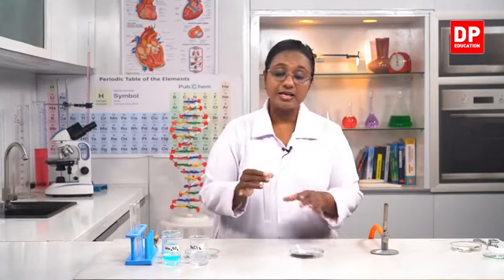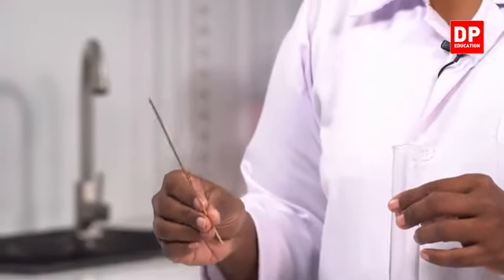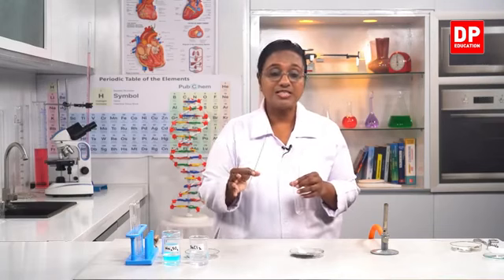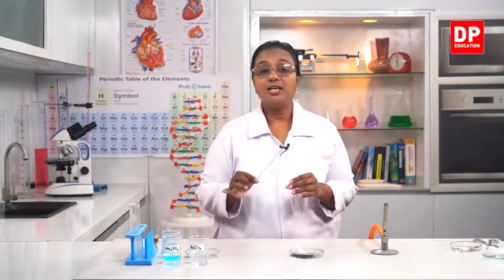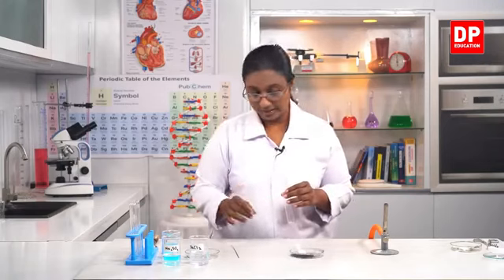Then what do we do? We need to take a boiling tube. Into that, I need to take a small amount of potassium permanganate and then I will be holding it to the Bunsen flame. At the same time, we need to have a glowing splinter there. While I hold it to the Bunsen flame, you will see there will be a change taking place, and it will be mostly visible as evolving of gases, liberation of a gas. At that time, if you hold a glowing splinter, you will see a change. So that is what you need to observe. Here I am taking only one reactant, potassium permanganate.